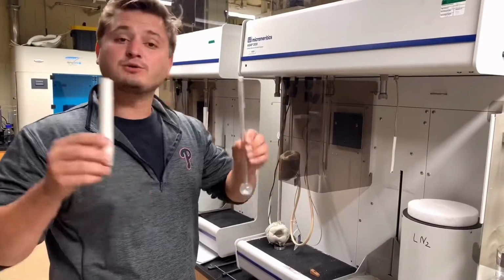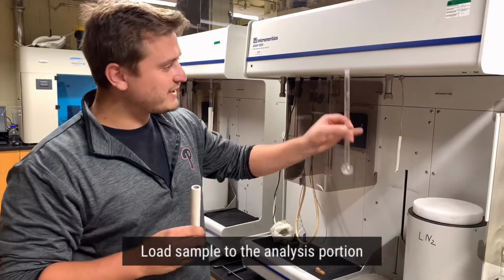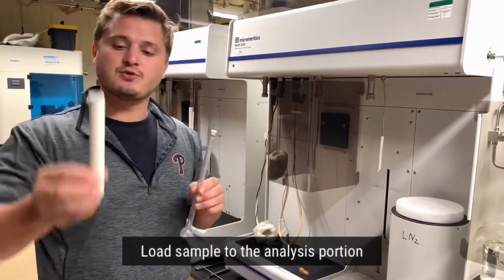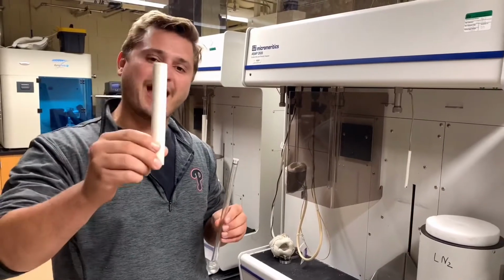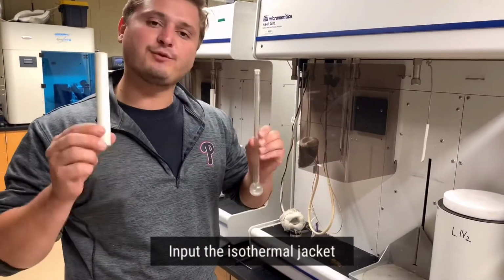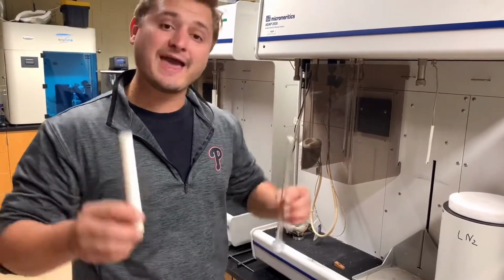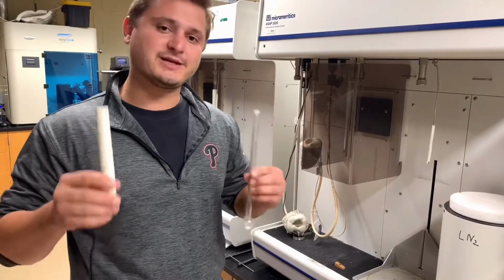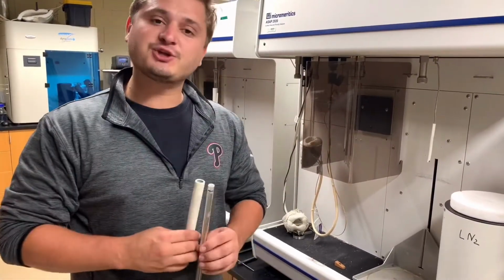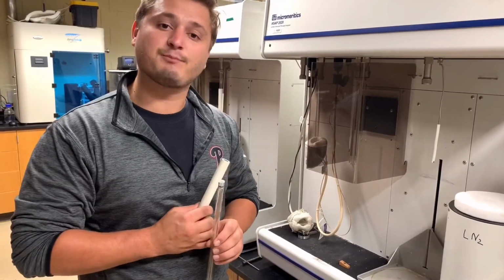So now we want to load our sample onto the analysis port of the instrument. The first thing we need to do is put the isothermal jacket onto the sample tube. When we are dealing with low temperatures, any variation in temperature can cause a variation in pressure. If there's a variation in pressure, that can lead to an increase of error within the sample analysis.